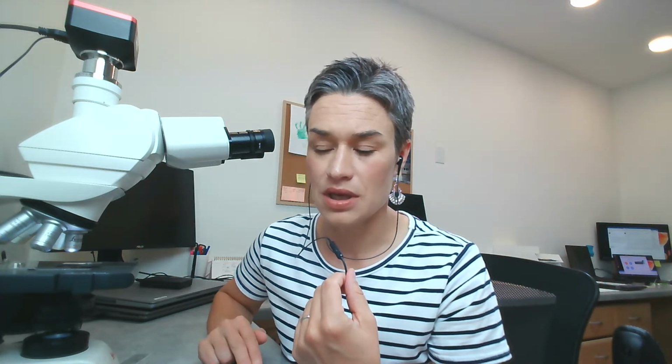Let's say I just wanted to count all those vacuoles and mark each of them as counted and have an automated output of how many I counted. How do we do that?